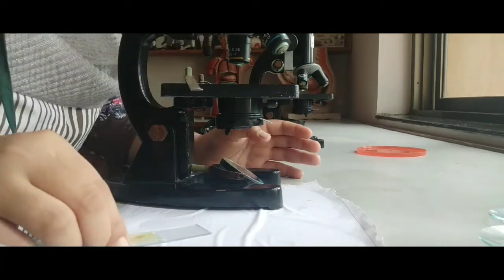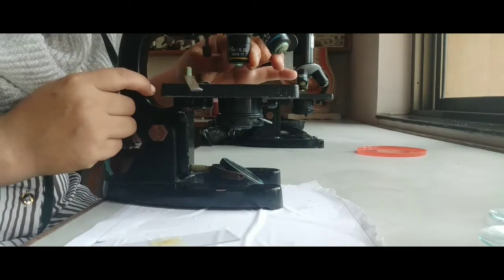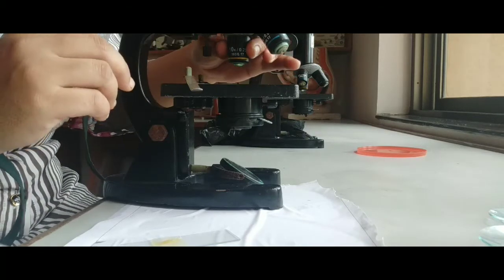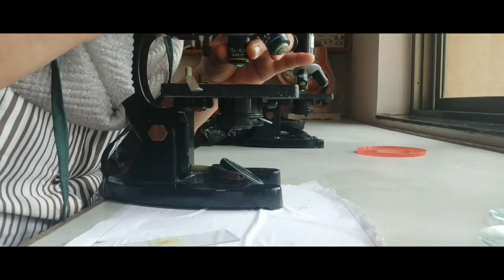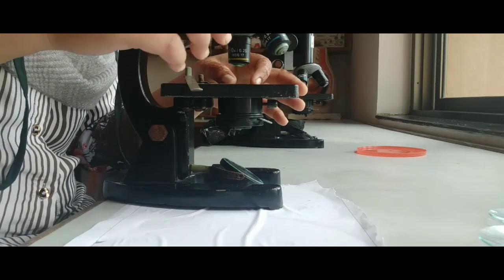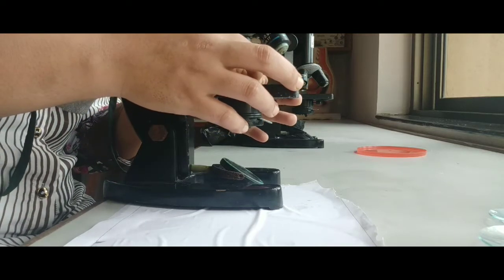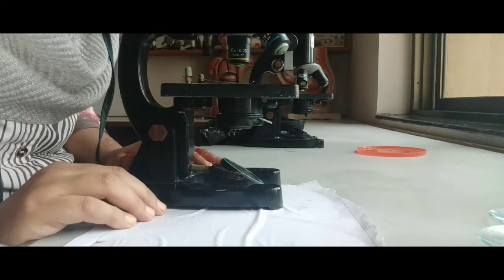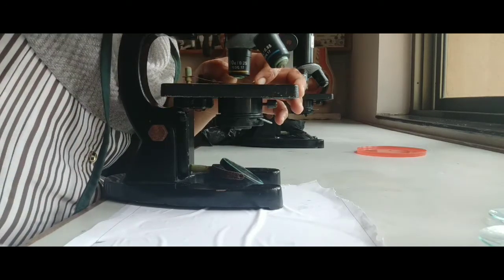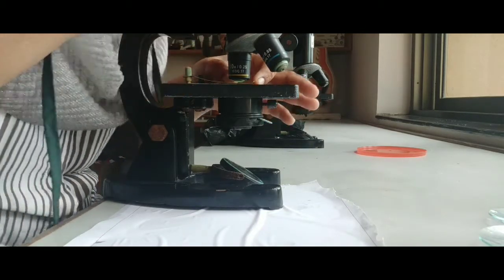We are observing this onion peel at the low power. At the low power means at 10x. You can see this is the lens on which it is written as 10x. So it is the low power observation, or we can say low power microscope. So we are observing this onion peel under the low power. Okay. After keeping the slide on the stage of the microscope, we have to keep these clips to fix our slide. And now with this coarse focusing, we are observing our onion peel, and we will observe plasmolysis in the onion cell.